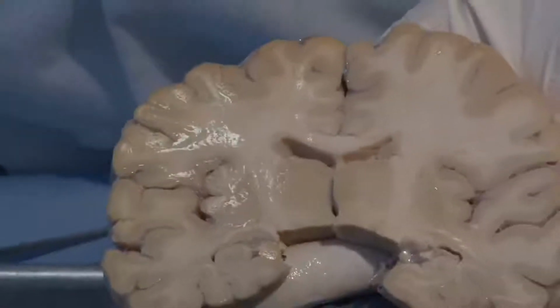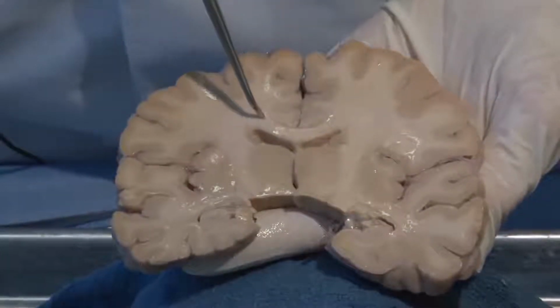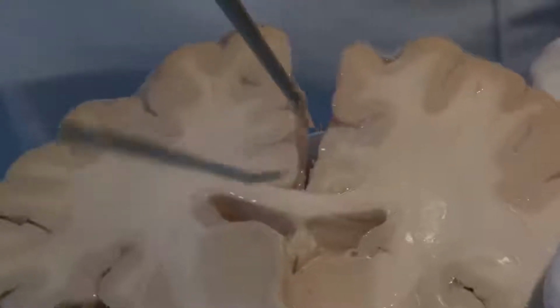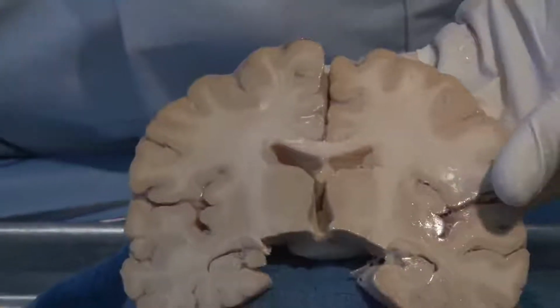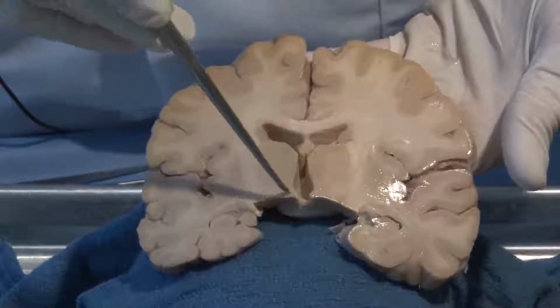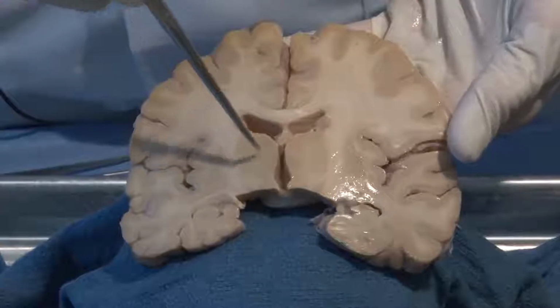An example of white matter here is this band of fibers called the corpus callosum. It was that band that held the two hemispheres together. When we were looking down through that interhemispheric fissure, at the base of that was this band of white matter connecting similar areas or homotopic areas of one hemisphere with the other. And this is a way that the right and the left hemispheres can communicate. In addition, they can communicate through structures like this deep area. You notice it's beige, so it's mainly cell bodies. A deep structure called the thalamus.